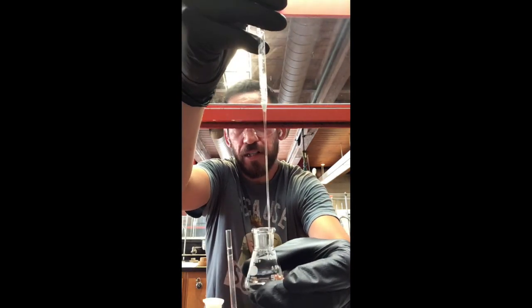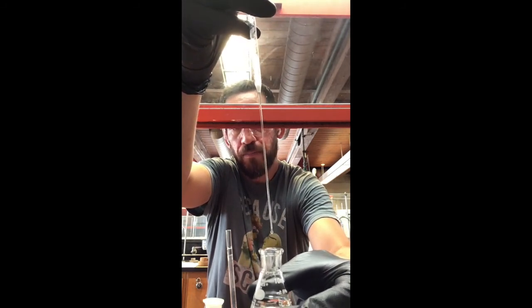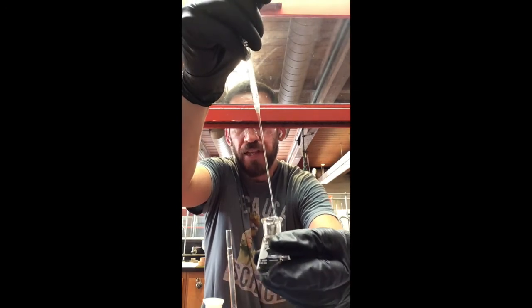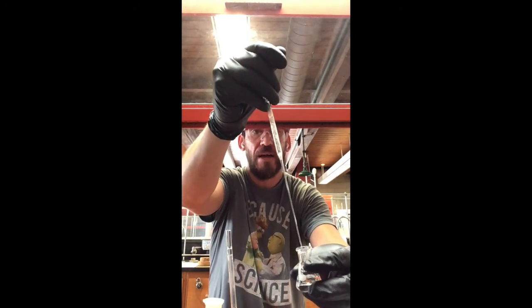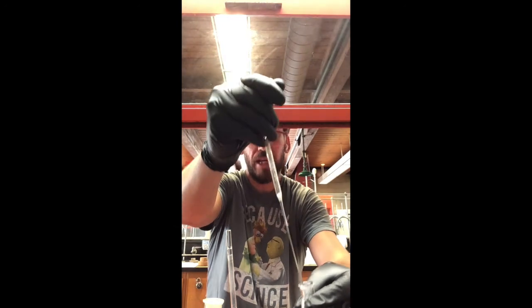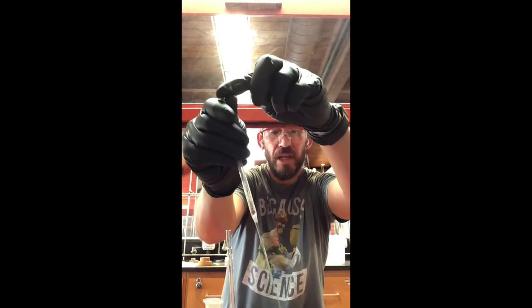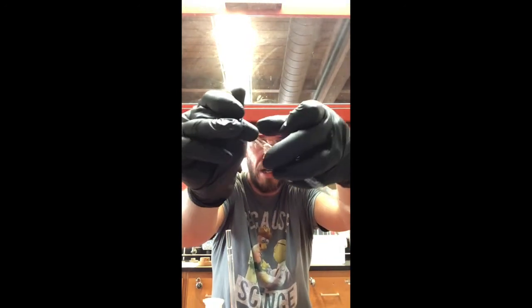It already kind of started coming down, but if I squeeze the bulb, you can see some stuff dripping out. One thing that's going to be really important in future labs and preparation of these types of things is don't let go of the bulb. See, my fingers are still pinched here. Do not let go of those until you've popped off the bulb, and now I can let go, okay?